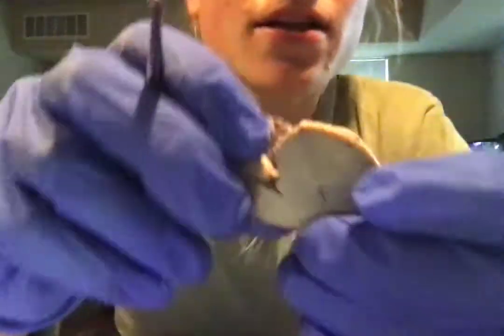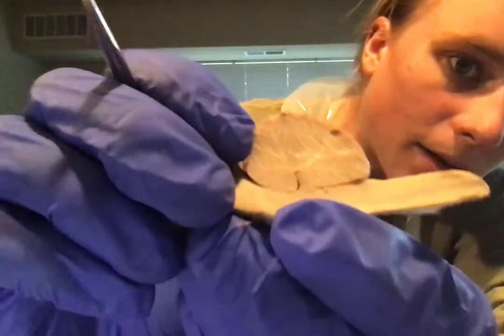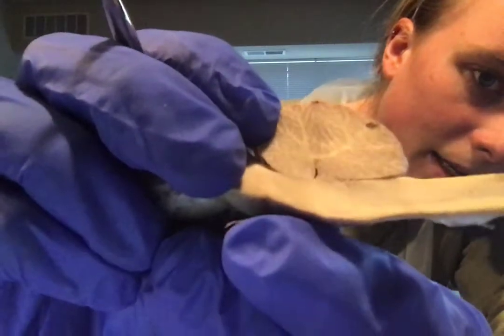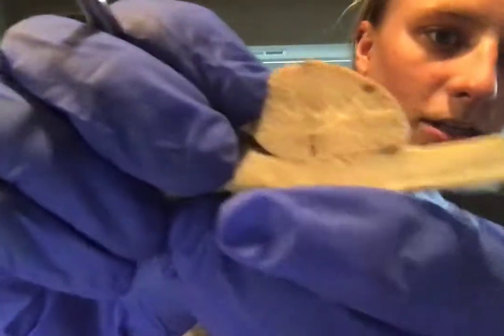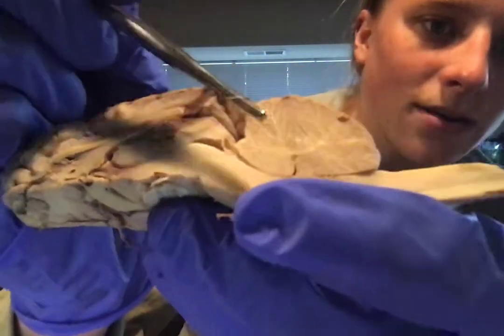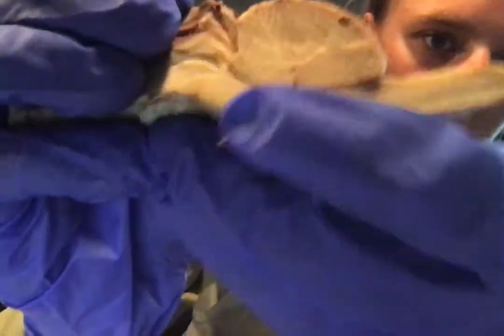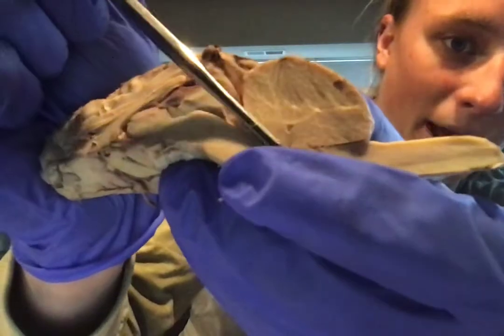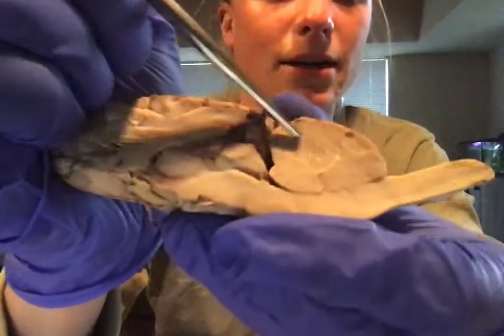And then if you look really closely into the cerebellum here, you can see that there is almost like a tree-like pattern in there. It looks like branches of a tree. So that is called arbor vitae. It got the name because arbor means tree, and you can see how it got the name. It looks like tree branches. So those white branch-looking things are white matter. So that's white matter inside the cerebellum.